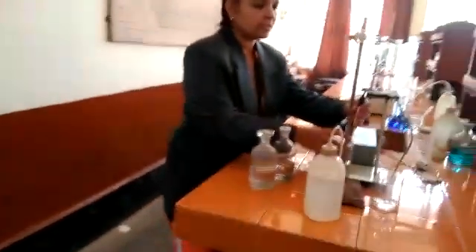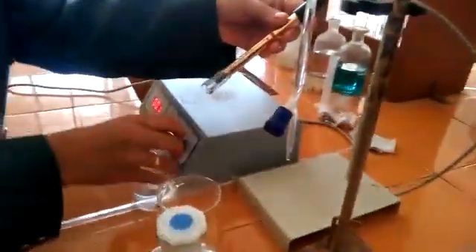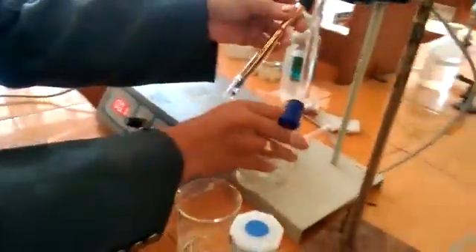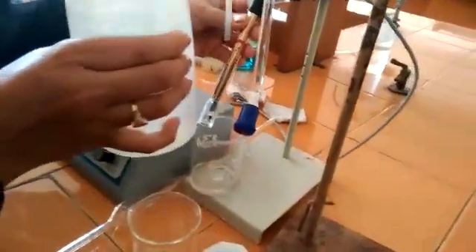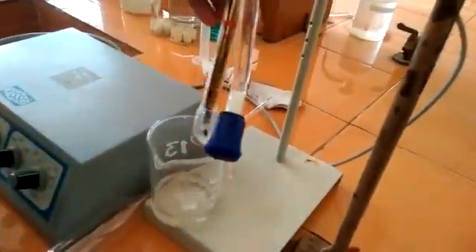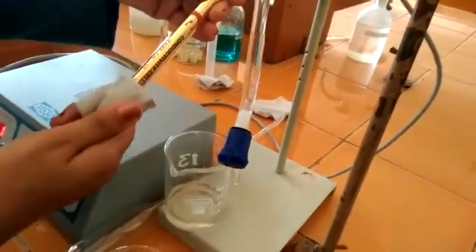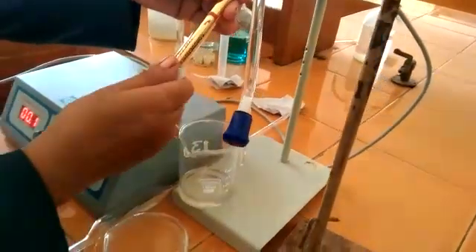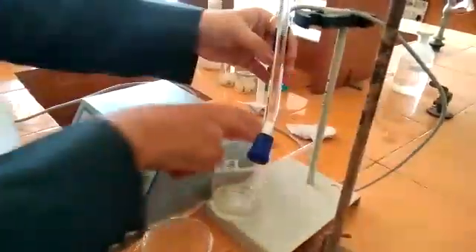This is the conductivity cell which we are using here. First, you have to wash this conductivity cell using distilled water, and later wipe it with filter paper. Even a single drop may dilute your given solution, so to avoid that you have to wipe it cleanly.